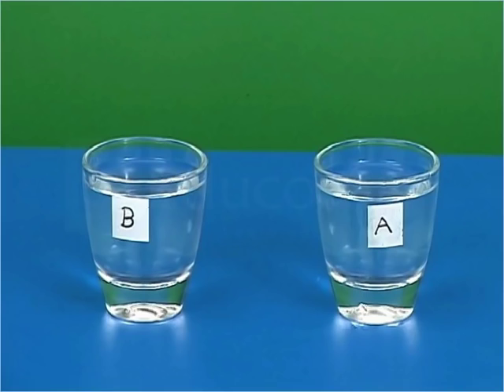Let us now begin the activity. Take two tumblers filled with water and mark these tumblers as A and B.